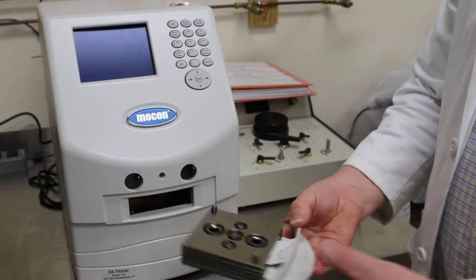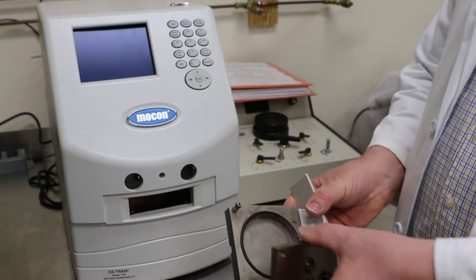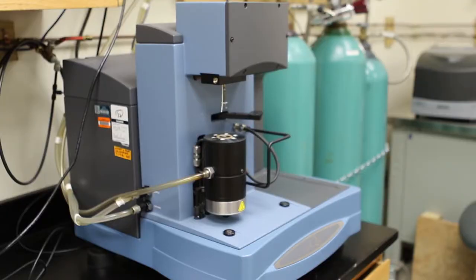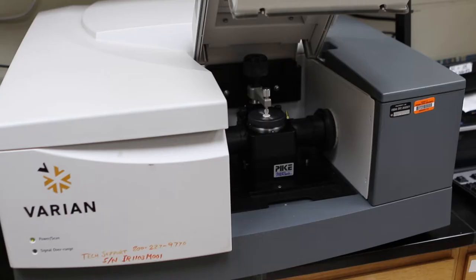The advantage of students working in this lab is that they might not have this experience unless they were a master's degree student or even a PhD student in other laboratories at bigger schools. Frequently, my understanding is that they're not even allowed to touch some of these instruments until they're at those higher levels. So what we train them on is one instrument is a thermogravimetric analyzer. That measures thermal changes in a material as it decomposes with heat without burning. Different materials have different decomposition properties, so this machine will give us information about composition and how that material breaks down.